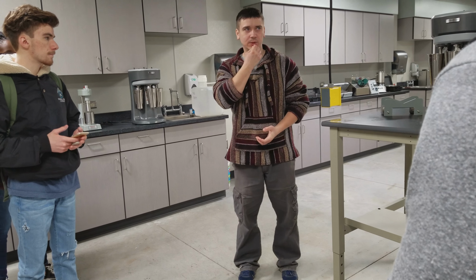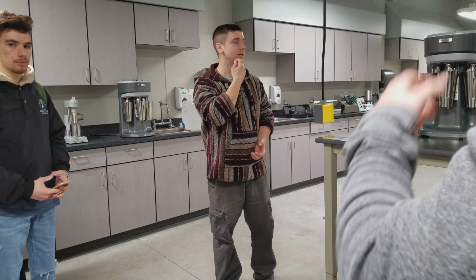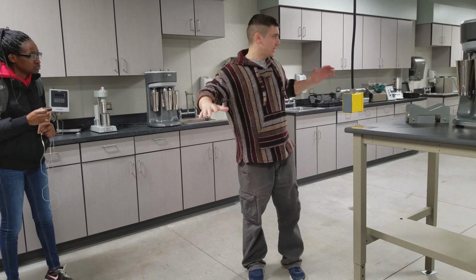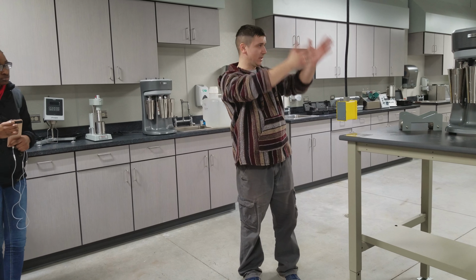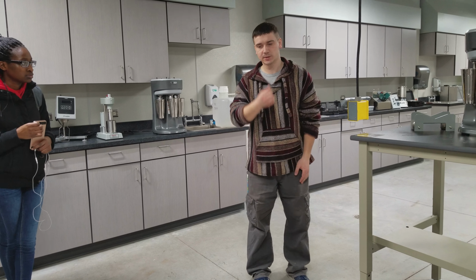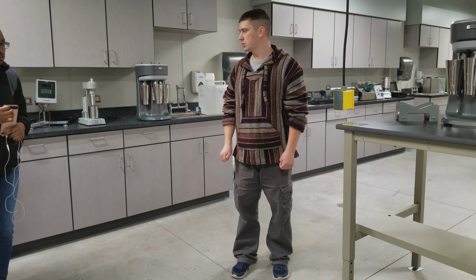In lab 1, there are going to be 9 experiments, and 4 in lab 2. This area here is lab 1, next door is lab 2. And I think they're spread across 2 different semesters. They're not crammed into 1 semester. So without further ado, we'll just go ahead and start.